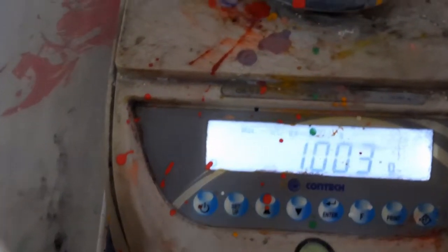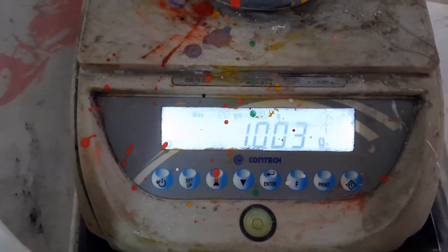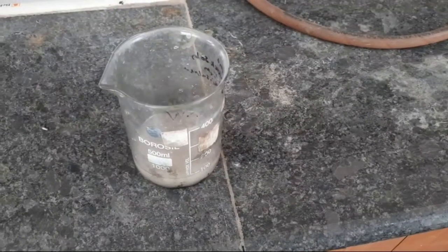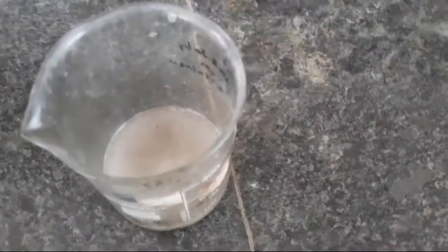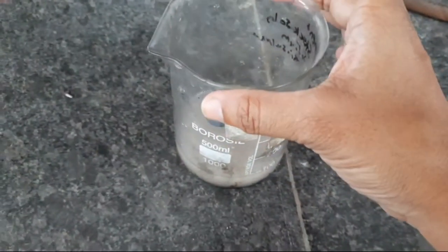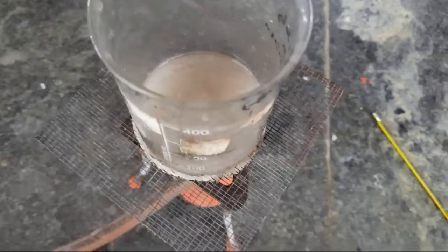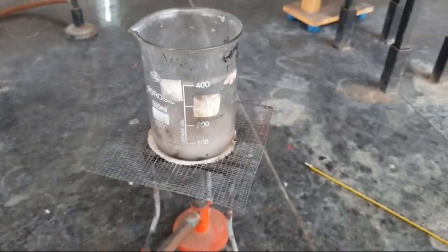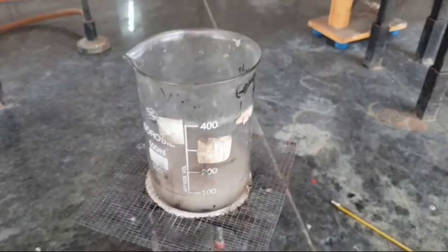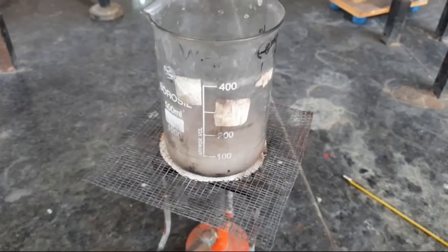Transfer that approximately one gram of ore into the 500 mL beaker. Add 100 mL of sulfuric acid and gently heat it on the wire gauze using the burner. This is the wire gauze. Heat it until the complete ore is dissolved.